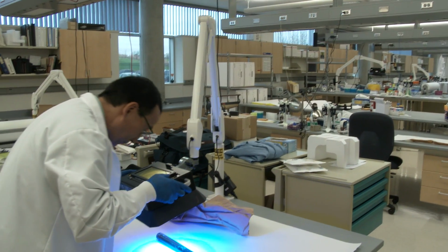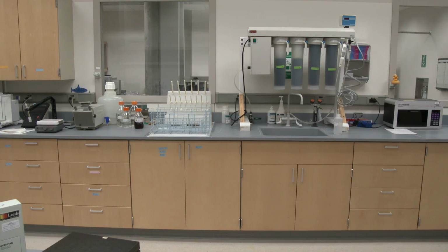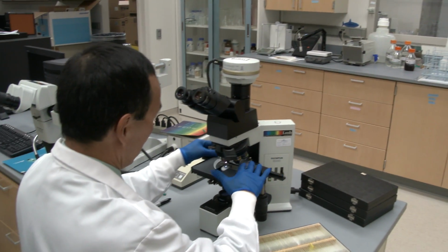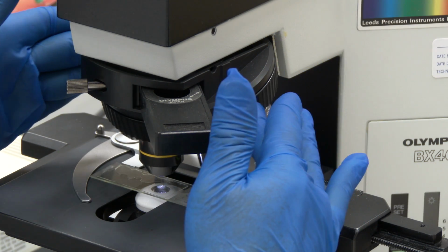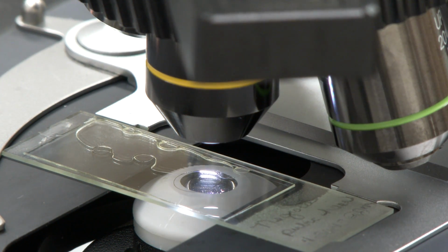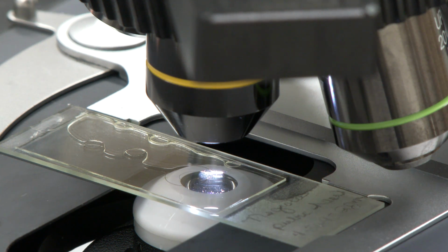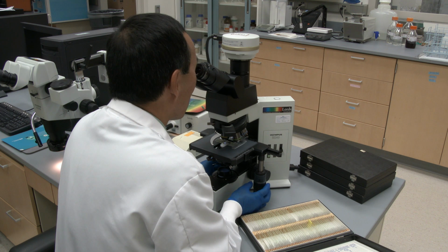Today, Paul Bush is the only criminalist still working at the DCI Crime Lab that used microscopic hair comparison back in the 80s and 90s, and he's confident with the DCI's previous practices. Let's say 20 to 25% of the cases there may be hairs submitted. Of those, again, probably a lesser percentage where the hairs were significant because we may have had other evidence in the case that was more significant, whether it be serology, blood typing results, or say fingerprints.